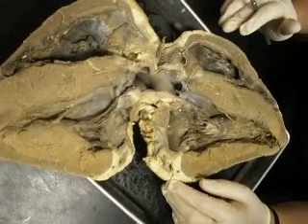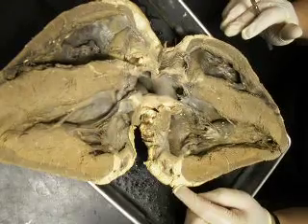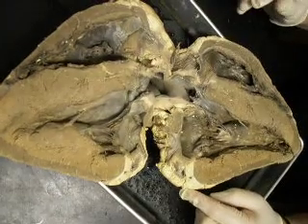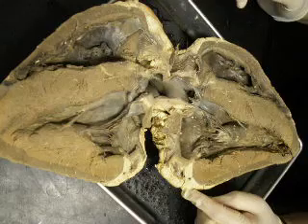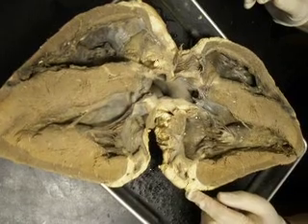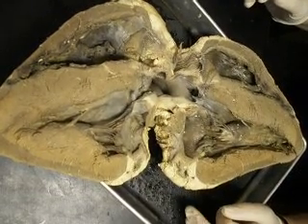Now, is the white, is that the endocardium? That's not fat. No, I meant the shiny white inside the ventricles. Well, it doesn't look so shiny anymore. It's getting kind of dried up. But is that the endocardium? Right. So the fluid-filled area is in the pericardium, right? The serous fluid is in the pericardium. Right. Gotcha. And that's it for this one? Okay. That's all you have to know on here.